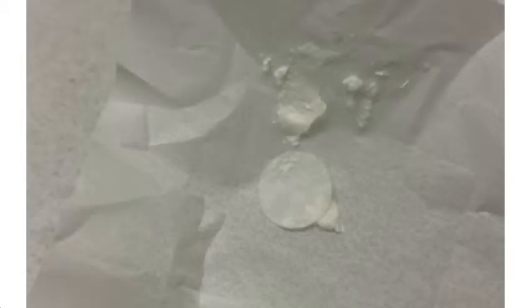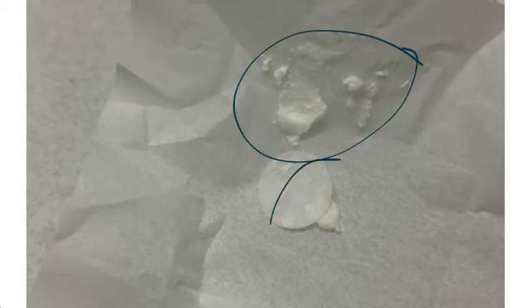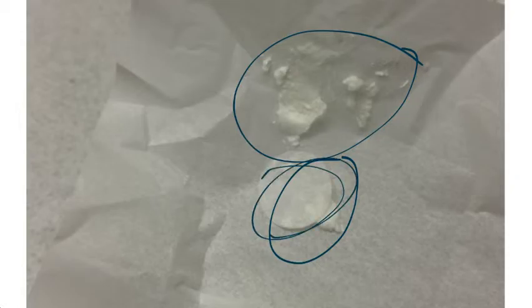We use a Hirsch funnel to remove any excess liquid, and that way we are left with just the acid, so that later we can weigh it to see the recovery. There was an unavoidable error at this step, because the crystals formed in more of a powder-like substance, and the powder was left on every piece of equipment that was used. It was on the spatula, the Hirsch funnel, the filter paper. We tried to get it off, but you couldn't get everything, and that lowered the amount of acid that was actually recovered at the end of the experiment.